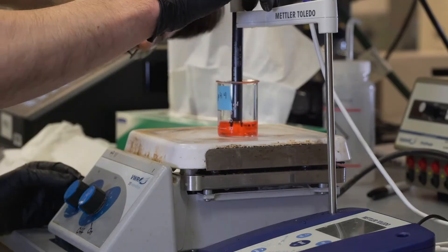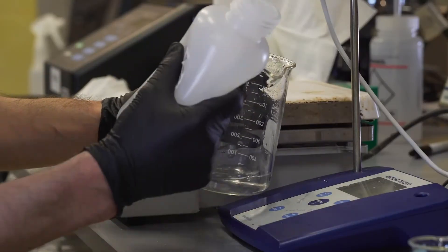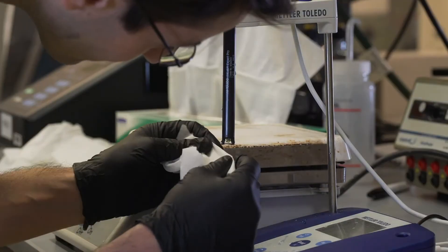Submerge, calibrate, stabilize, rinse, and blot.